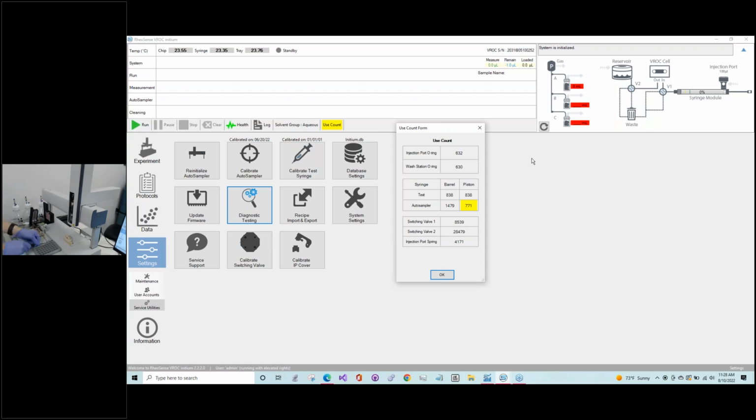And I guess also I'll point out that when you have to make the swap out for the piston or syringe, it's probably a good idea to periodically clean off this region, because part of the reason the screw can get stuck is with the backside cleaning, you have the salts from the buffer that can build up a little bit and then make it a little difficult to get off.